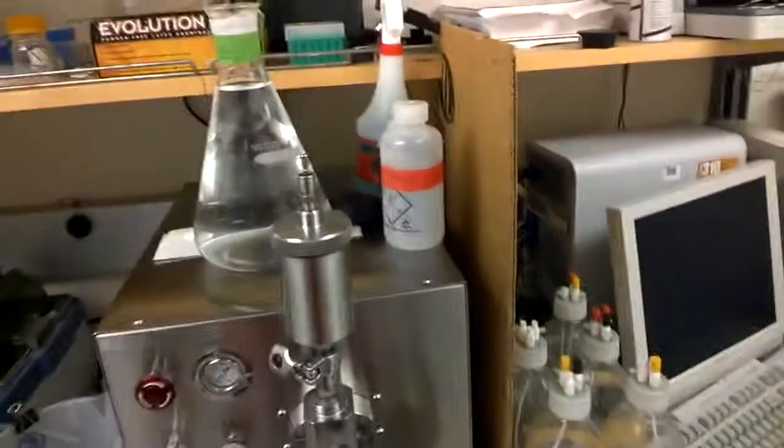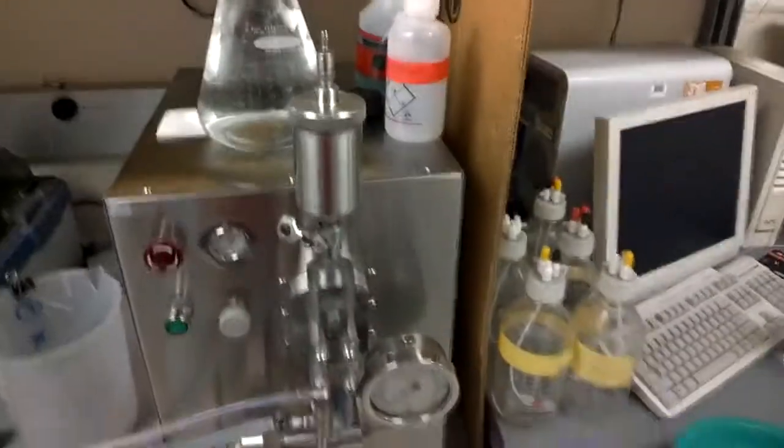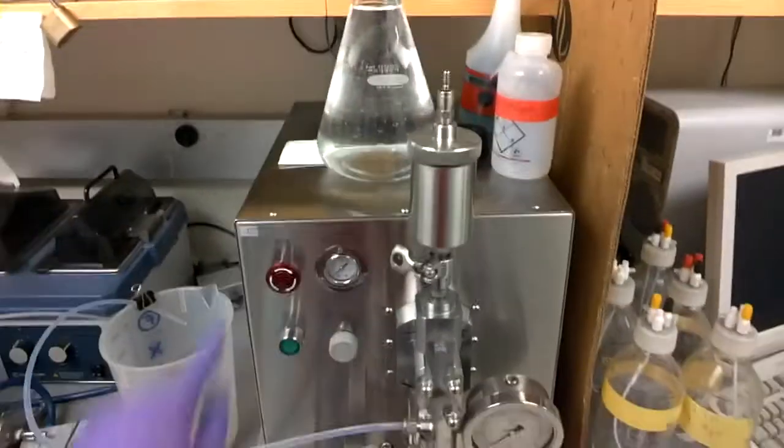Hello. Today we're going to learn how to use the Emulsiflex, which is this machine, the Emulsiflex C3.